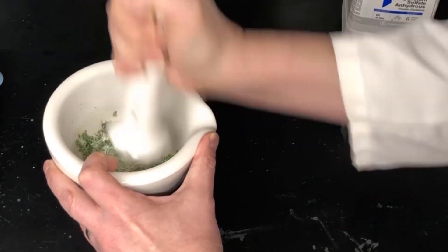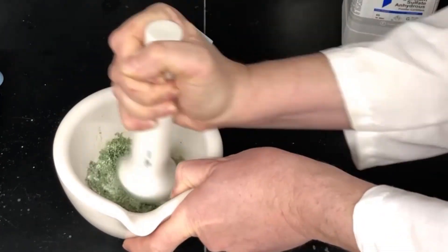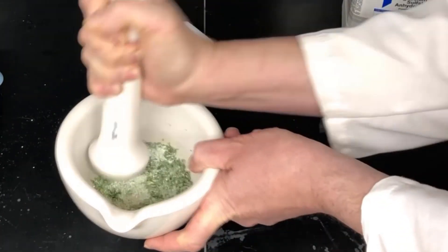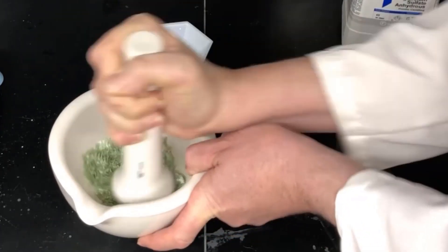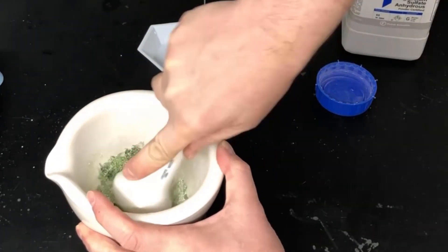And as I grind here, you can see that the material changes in its consistency. It goes from being sort of a wet cakey mass to more of a fine powder, a free-flowing powder.